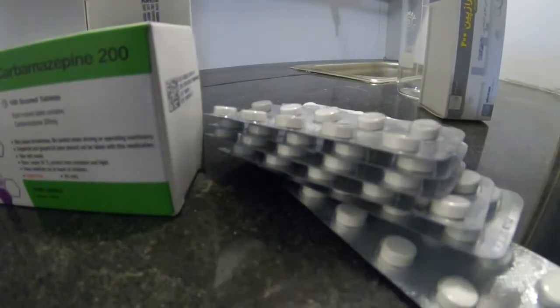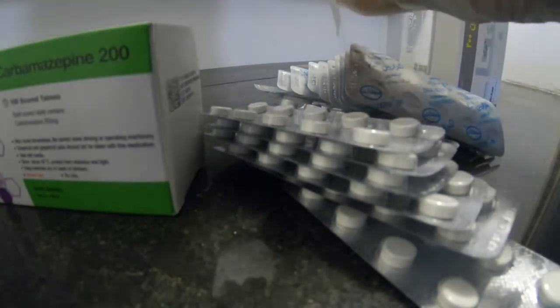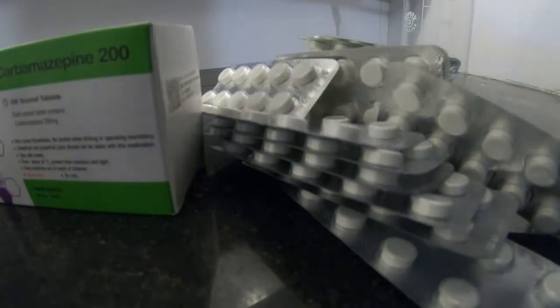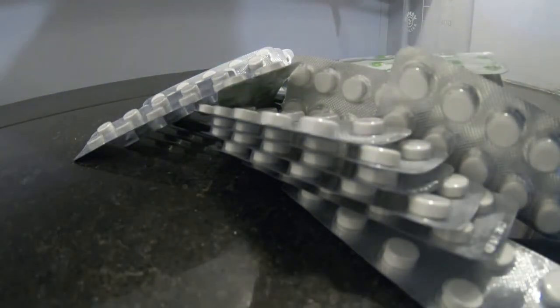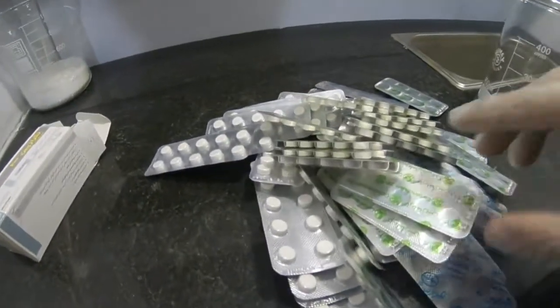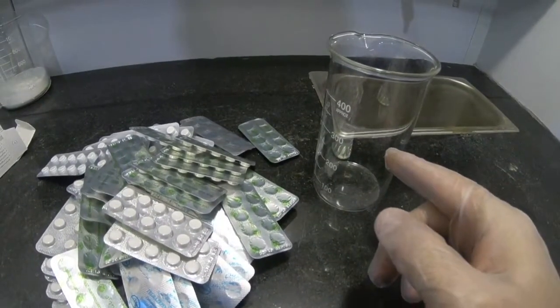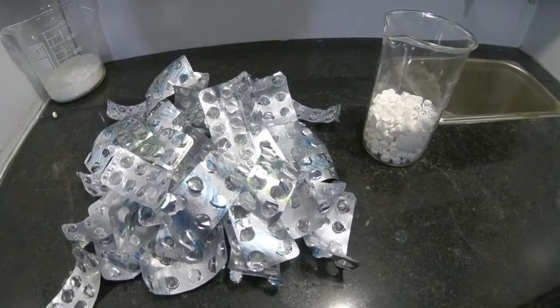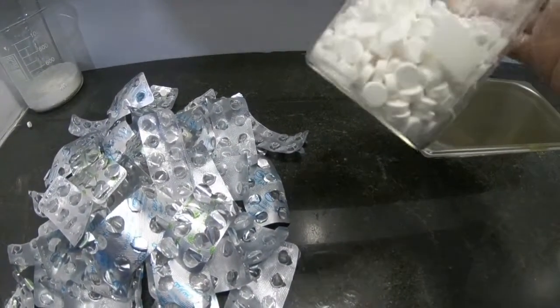First I'm going to take all of them out and gather them in this beaker. I have 500 carbamazepine pills, and we are going to powder these.